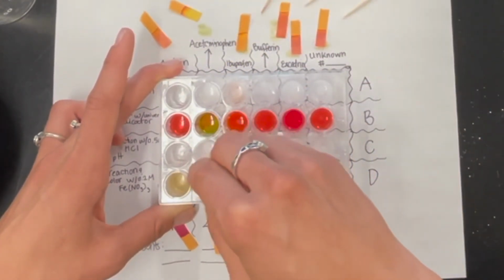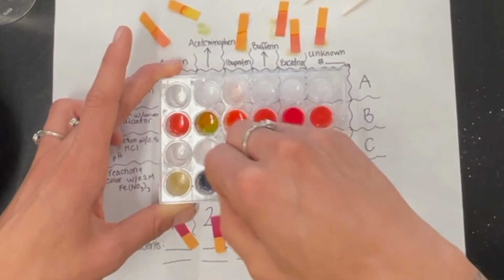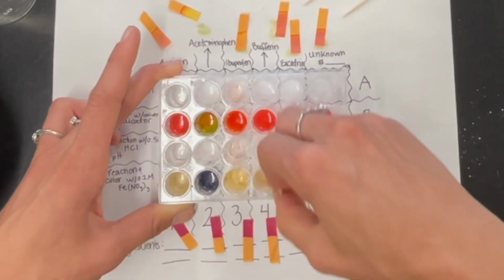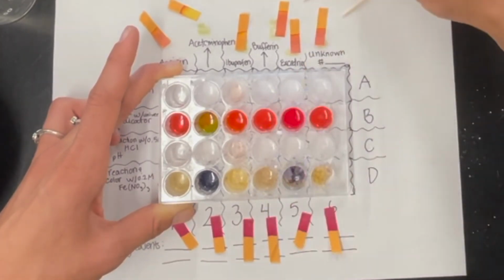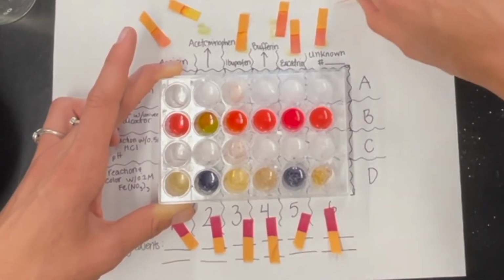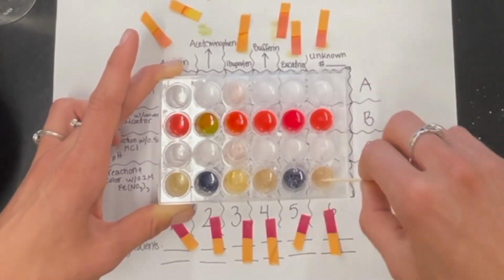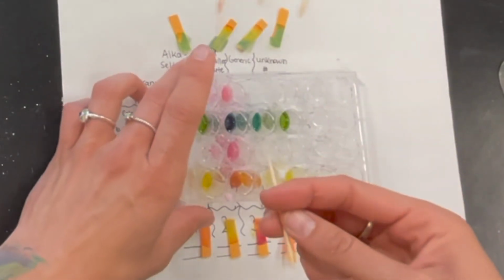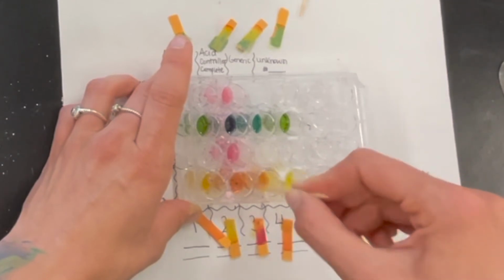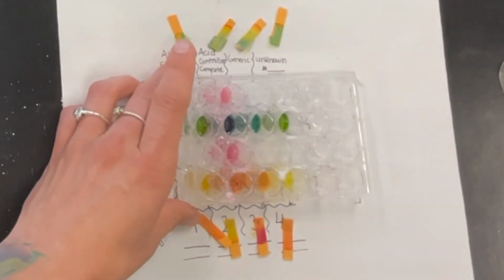So we want to look for two things: the reaction, in terms of are we seeing fizzing? Are we seeing a dissolving? Are we seeing really anything notable? And then we also want to see if we are noticing a color change, which we definitely can already see for at least the acetaminophen and the Excedrin. Pretty significant color change here. Once again, this is the nice part of having a video, we can compare and contrast. It's much more goopy and congealed with the antacids than it was with the pain relievers. So that's something interesting to note.